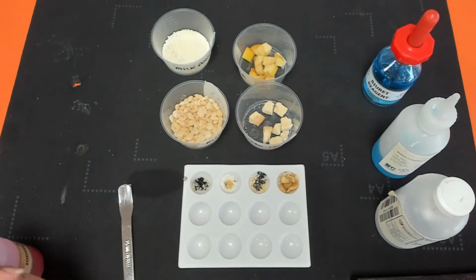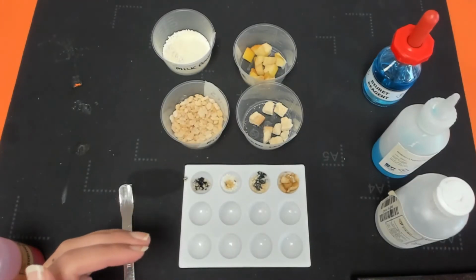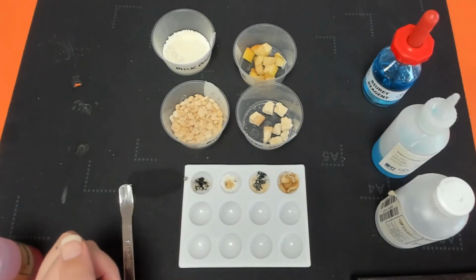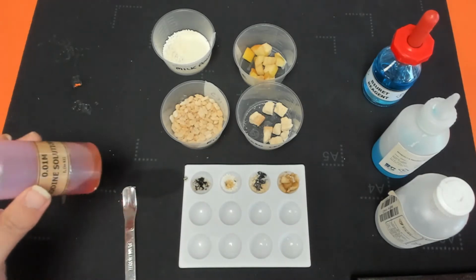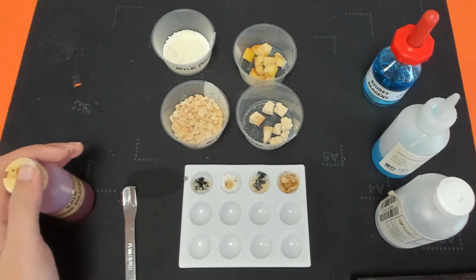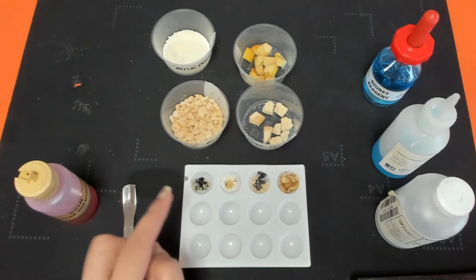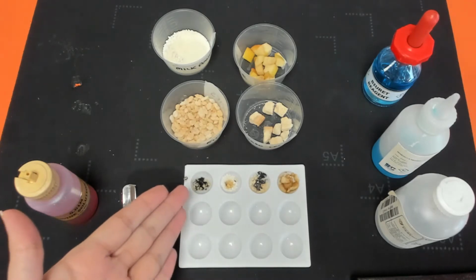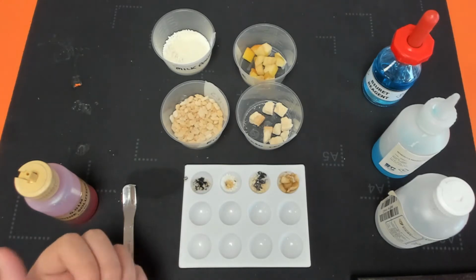What we can see here is that the Rice Krispies and the custard cream, they've both turned a sort of bluish black colour. Meanwhile, our milk powder and our apples, we haven't really seen a change because iodine was yellowish orange to start with, and that colour has not changed at all. So we've kept those two the same. So when nothing happens, we call that a negative result. The positive result is the change that we can see. And if our substance does change colour to blue or black, that indicates that we do have some starch present in the food or whatever we're using.